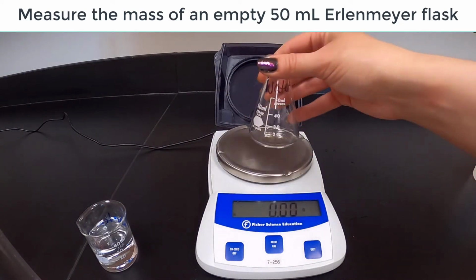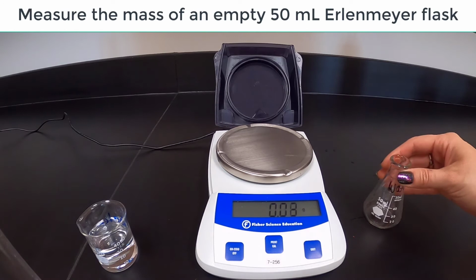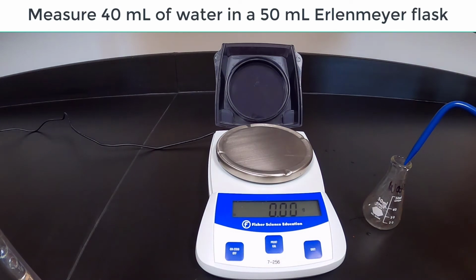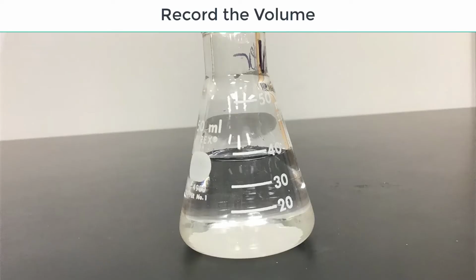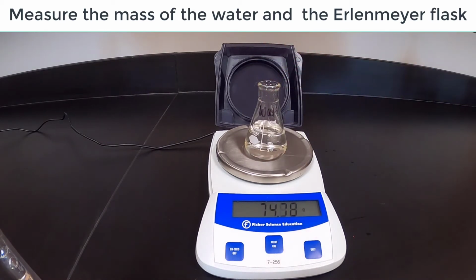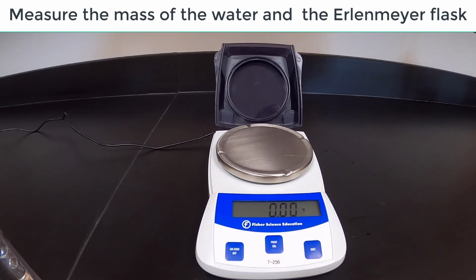Record the mass of a 50 ml Erlenmeyer flask. Measure 40 ml of distilled water into the Erlenmeyer flask. Record the volume. Reweigh the Erlenmeyer flask with the water. Record the mass. Calculate the mass of the water.